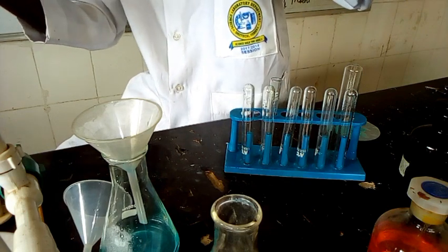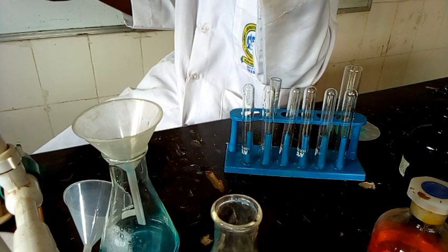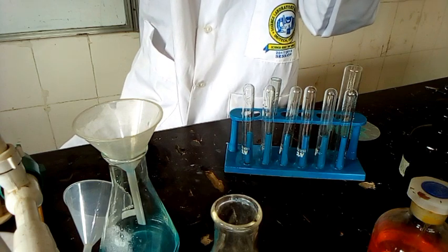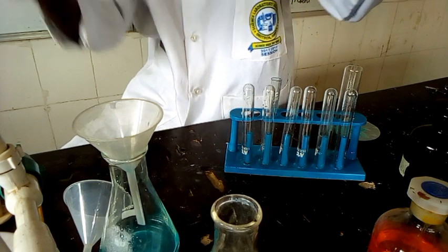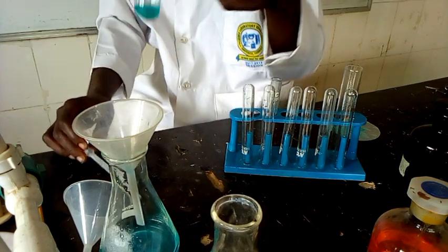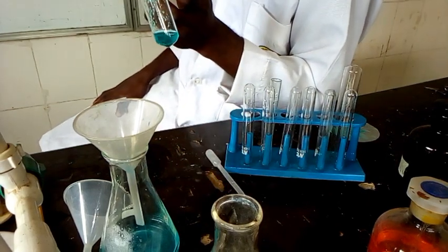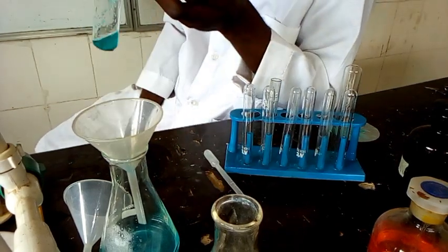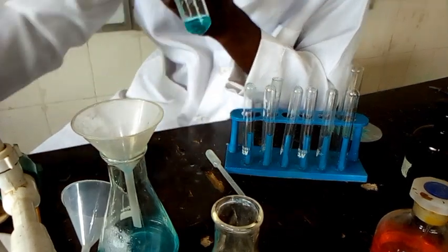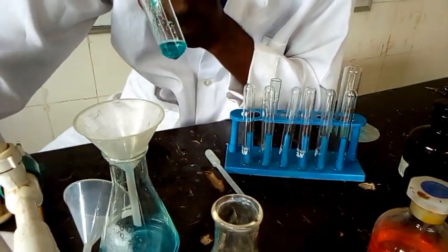Actually, I'm having a kind of blue solution here. Then a deep blue solution is formed. Actually, a little effervescence occurs. Can you see that? That is what happens when HCl is added. Then what will be your inference? Effervescence occurs, so we should be expecting a colorless, odorless gas which turns lime water milky, evolved on the addition of HCl.